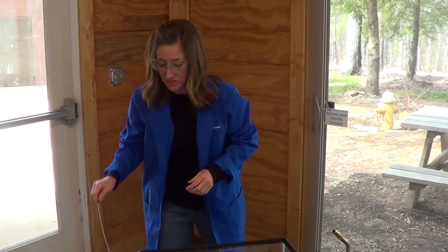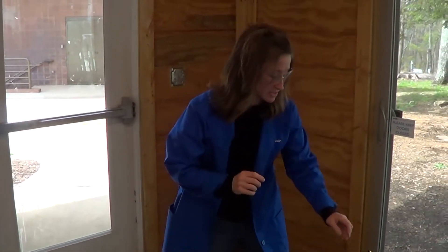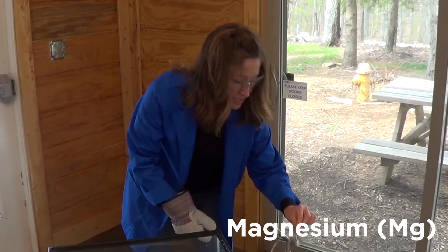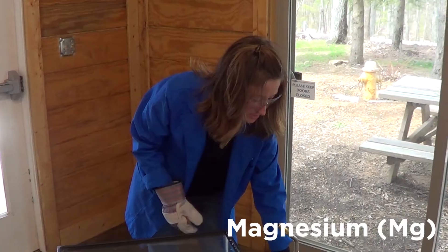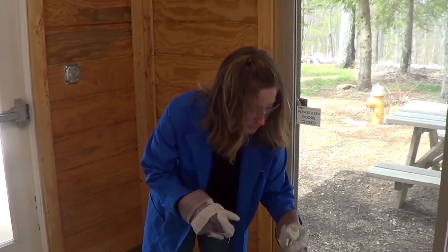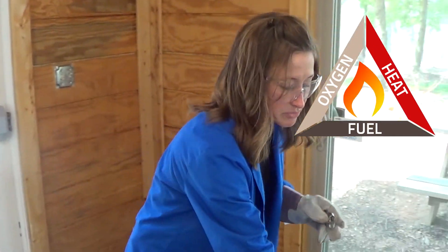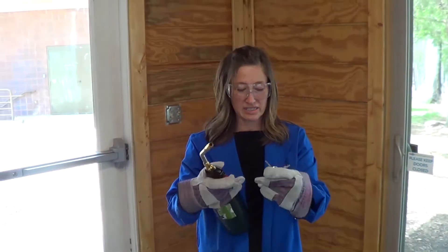Now I want to take a slightly different substance. This stuff is called magnesium. It is a metal and it's fairly reactive. What I'm going to do is light it on fire. We know we need three things for a fire: heat, fuel, and oxygen. This is our fuel, oxygen comes from the air. I'm going to use heat from something a little different this time because I need a lot of heat to get this started.